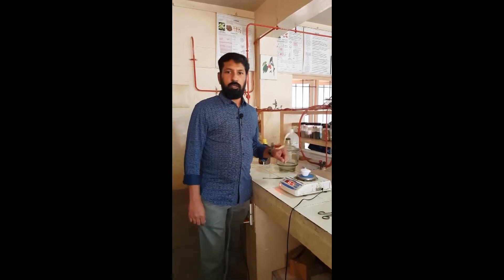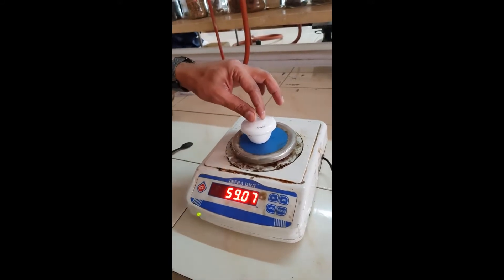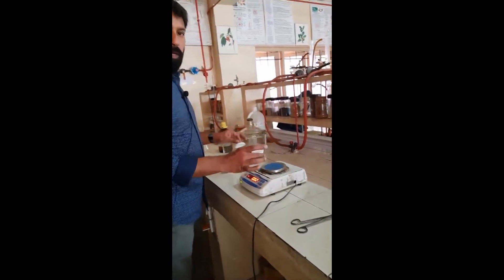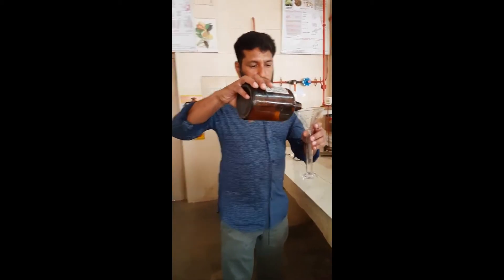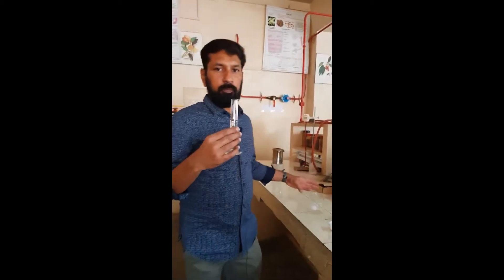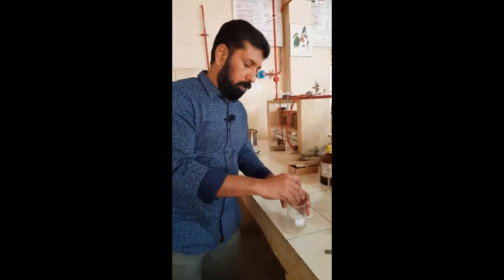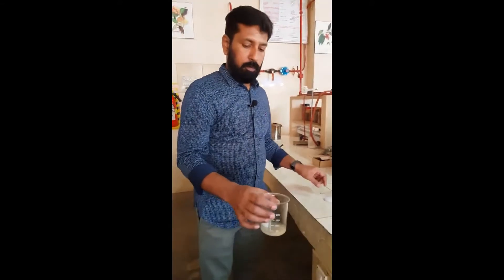This acid insoluble ash value is the continuation of the total ash from the last video. So we have the crucible plus lid and this total ash is 55.17 grams. Now what we have to do is take this crucible and ash. We are measuring 25 ml of dilute hydrochloric acid with the help of a measuring cylinder. So we have taken exactly 25 ml of dilute hydrochloric acid in the beaker, and now we are adding the total ash into this 25 ml of hydrochloric acid.